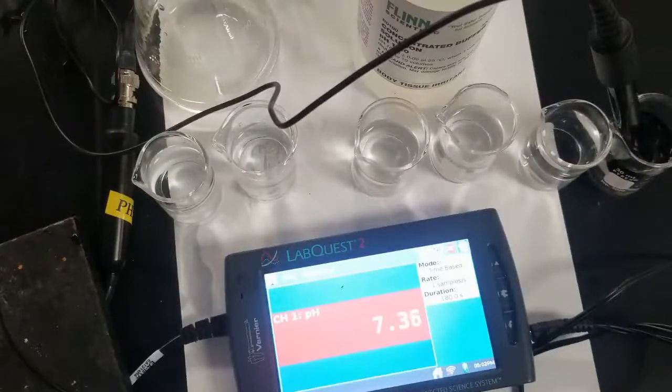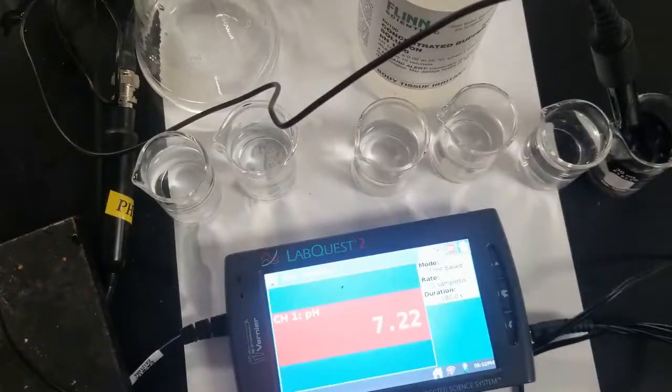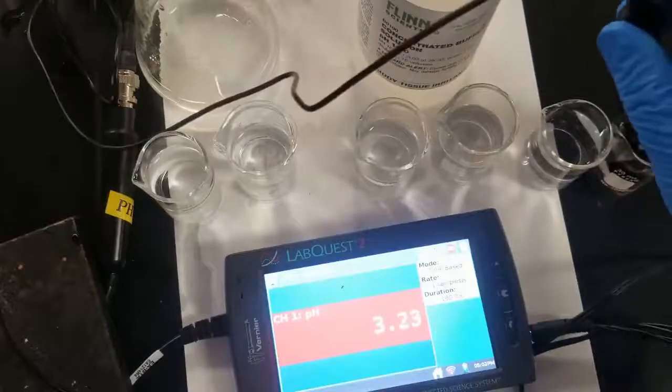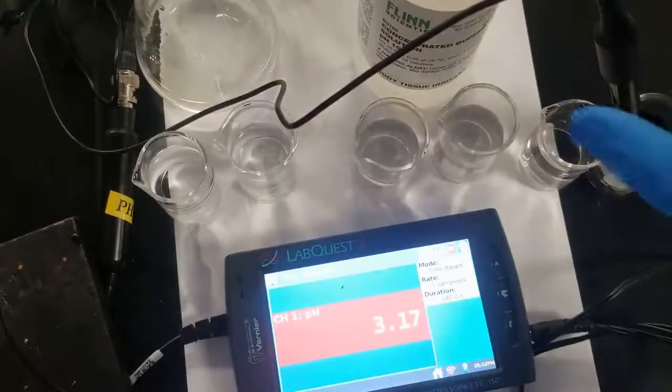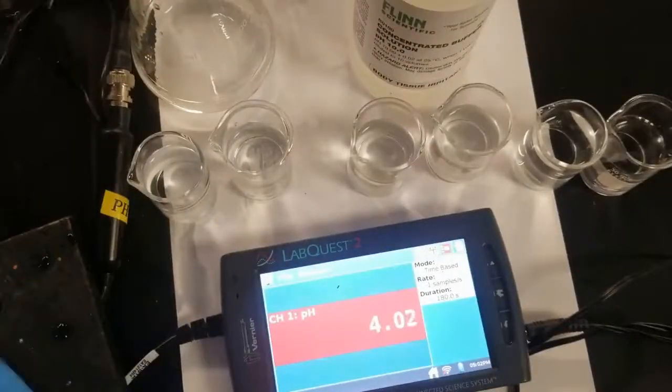And so it'll continue to drop for a little while, but you can see the trend there. Let's see what happens when we add some acid. You can see it's going down very slowly. 1, 2, 3, 4, 5. Give it a little stir. And look at that. Our pH has dropped rapidly, right? Again, this is an unbuffered solution. You add acid or base, you make the solution acidic or basic almost instantly, right? Very small amount. We've got 25 mL of water and only 4 or 5 drops of not very concentrated acid and base, right? It's only 0.1 molar.